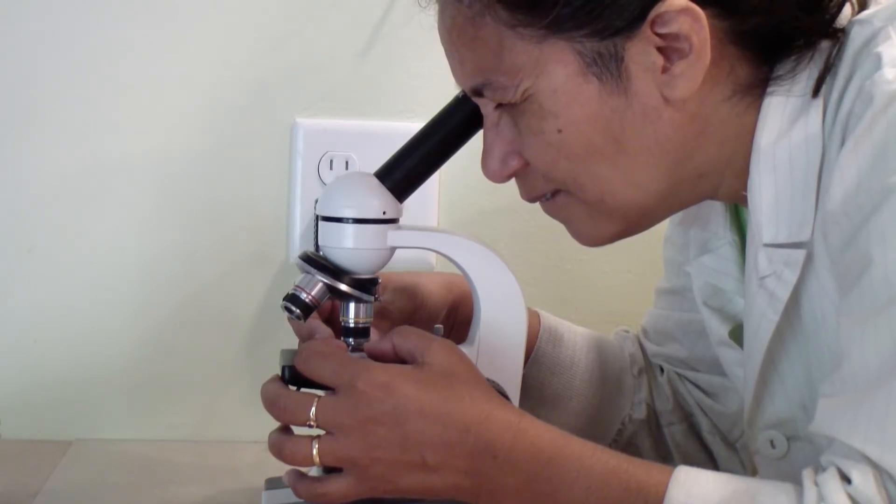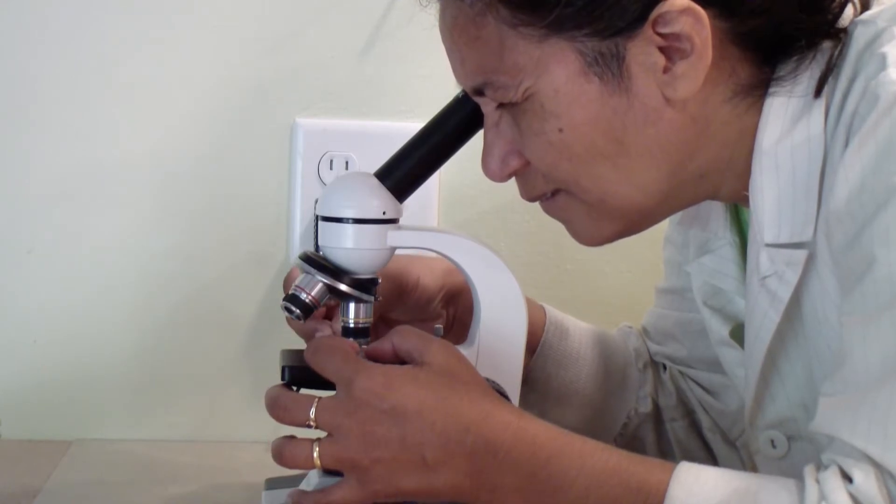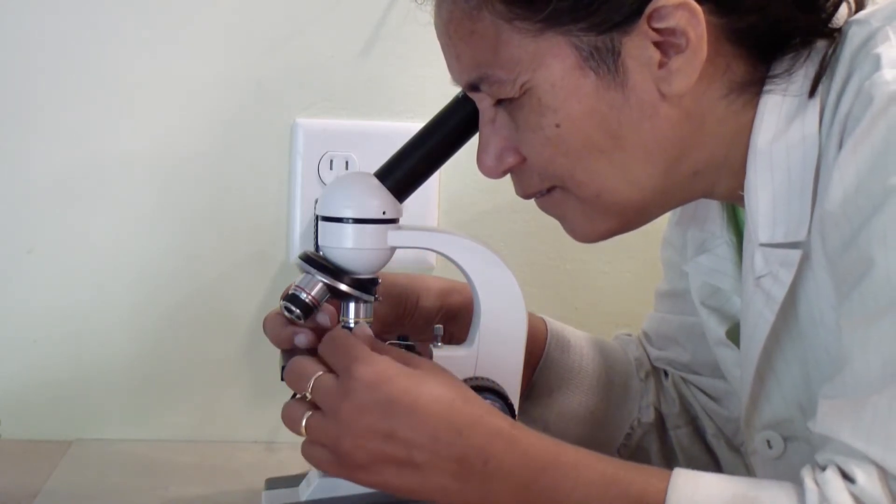Feel free to try and take pictures or video. There is a separate demonstration video on how to do that.